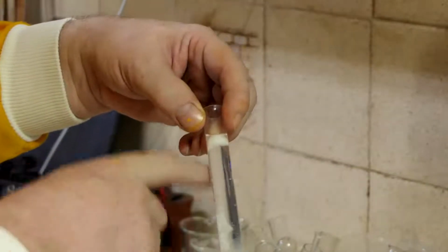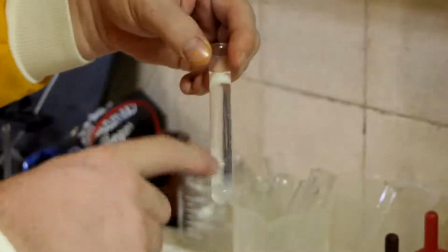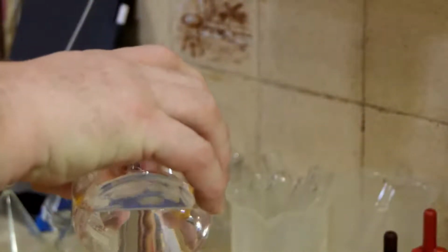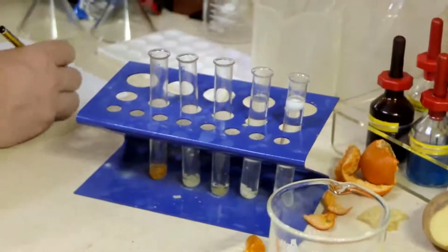It's denatured. And I think that was the alcohol that did that. I'm not sure I can see it being cloudy. We'll compare them with some others. Looking fairly clear, so I'm going to say no to the first two.